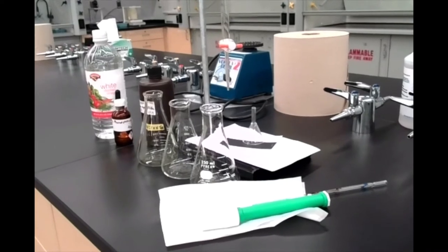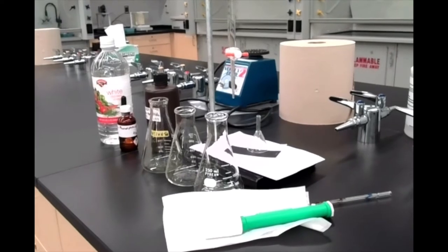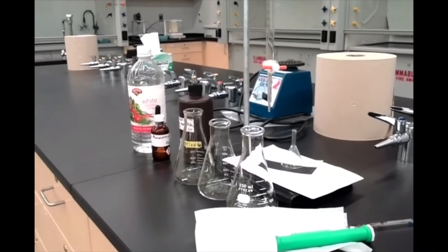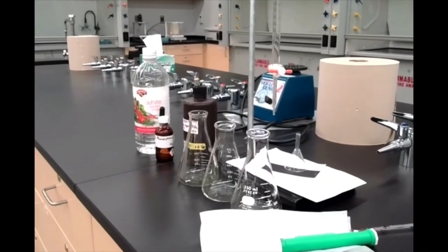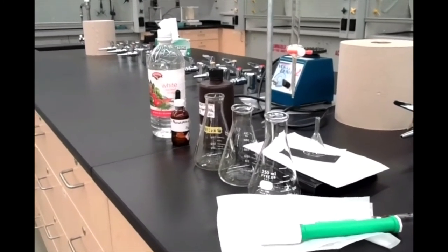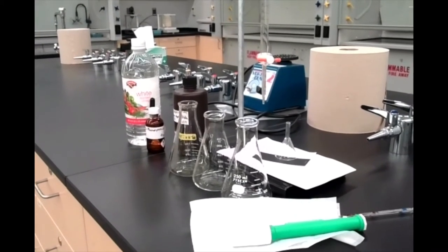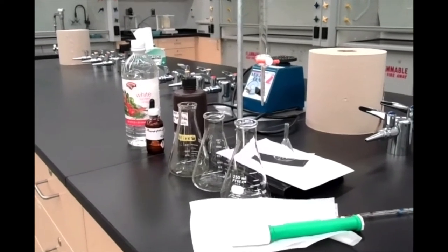In this week's lab, we're going to practice an analytical technique called titration. Titration is a technique where, by carefully measuring the volume of a quantity of known concentration, we can calculate the concentration of another material that has unknown concentration but known volume. We're going to do just part A of this lab, where we figure out the concentration of acetic acid in vinegar by titrating it with sodium hydroxide.